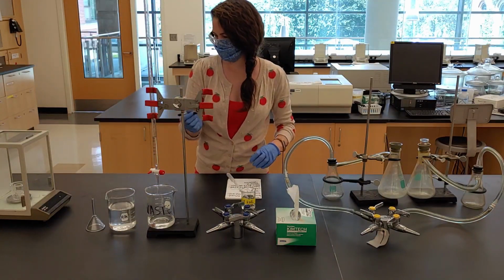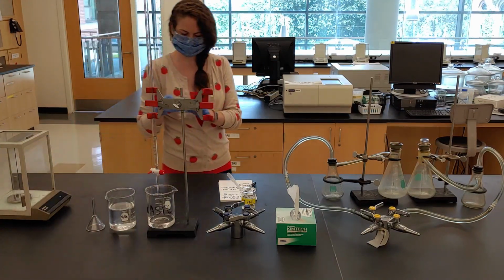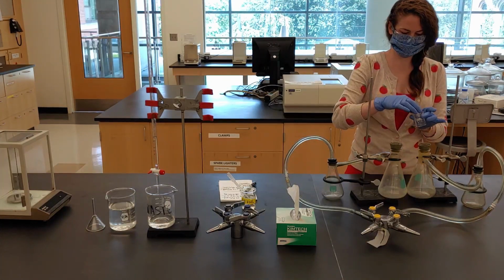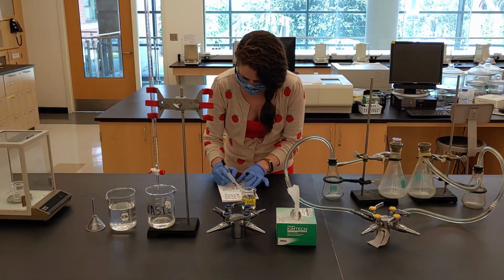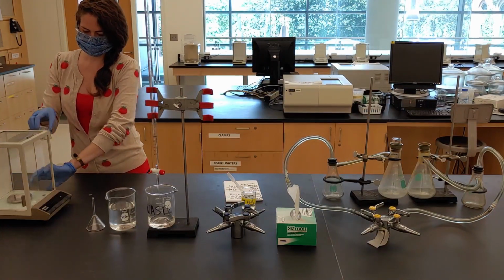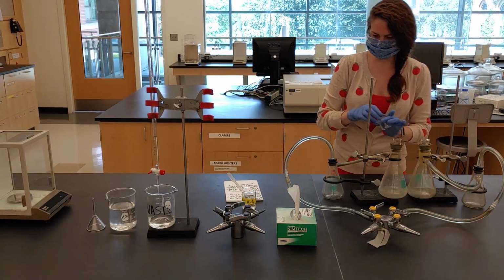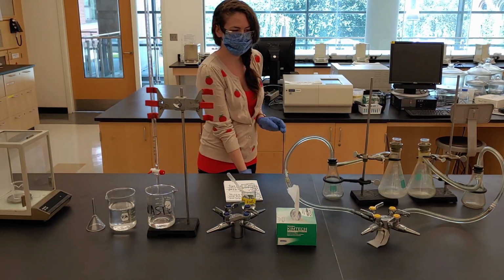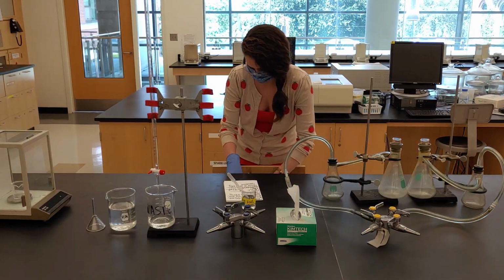These will be your tare masses for the two trials. Carefully remove the 2 reaction beakers from the drawer.